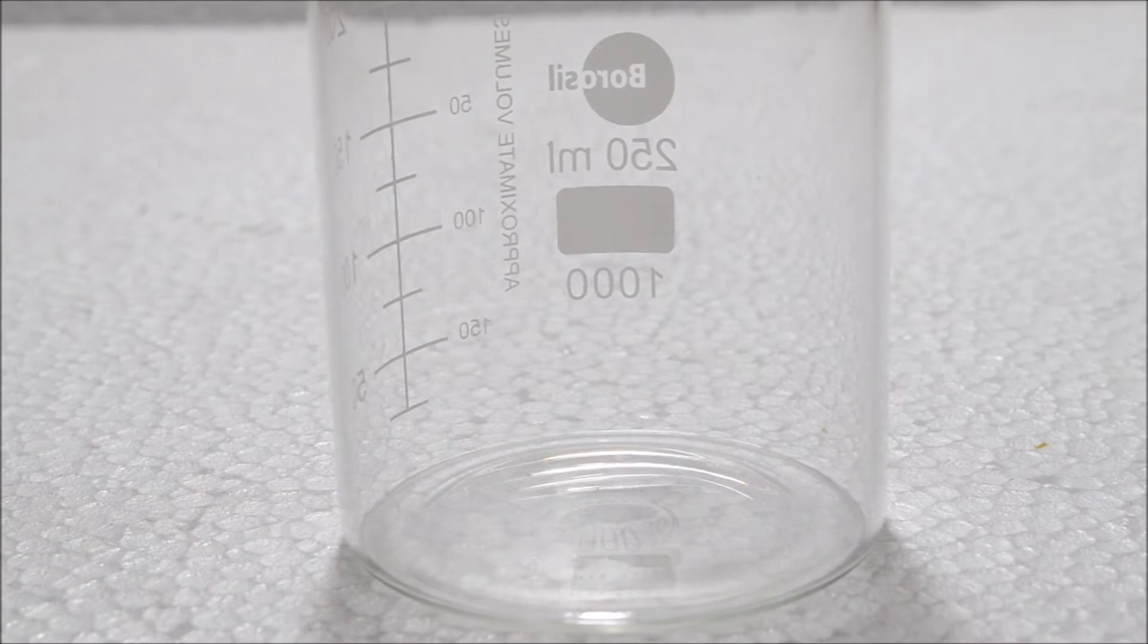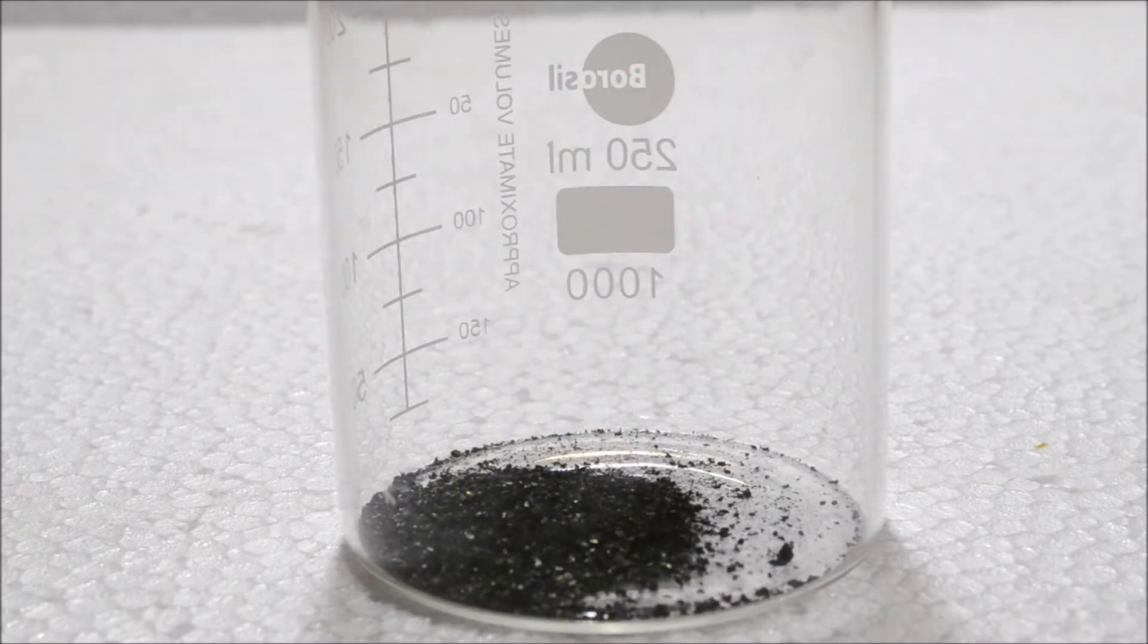In a clean dry beaker, crushed and dried crystals of potassium permanganate are added.